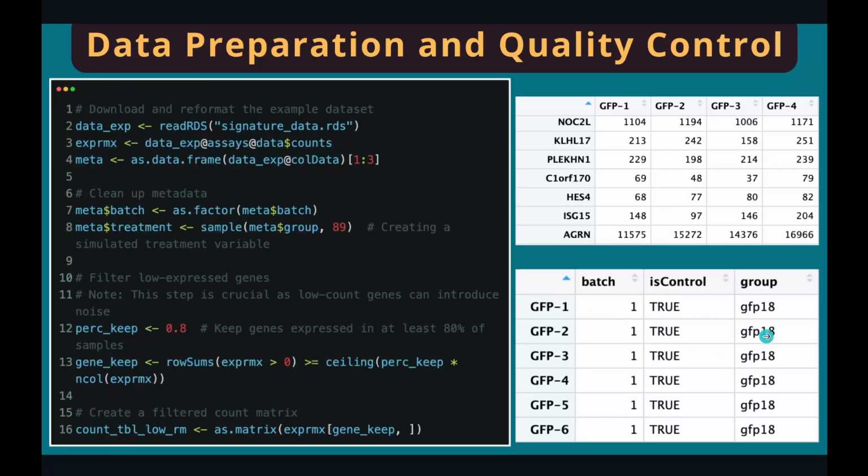Here is a meta table for sample information. And then we changed the batch column into a factor using the as.factor function. And next, we sample the groups to create a simulated treatment variable. And then we do some QC steps to remove the lowly expressed genes in our gene expression matrix.